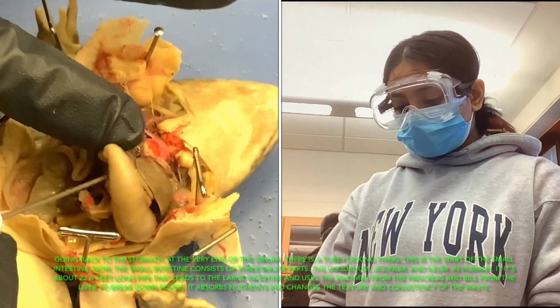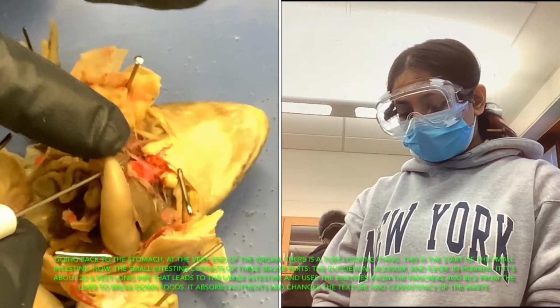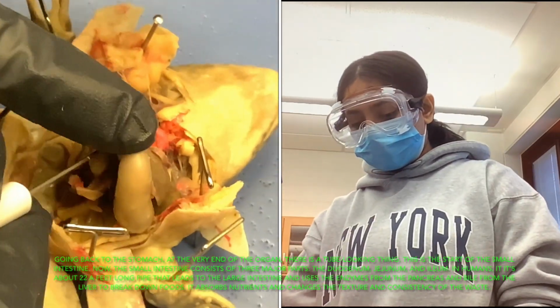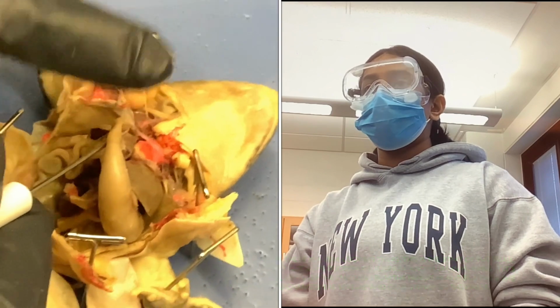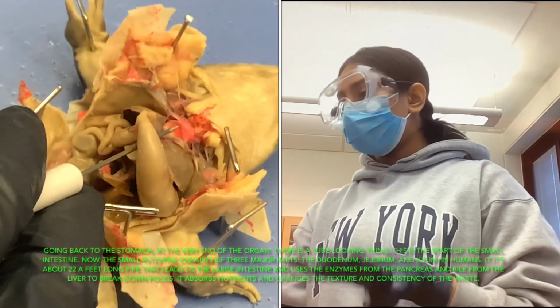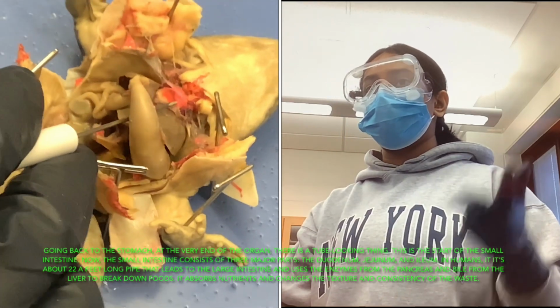We're going back to the stomach right here, and you can see I'm holding a little tube-looking thing leading from the stomach. That is actually the start of the small intestine. Now, the small intestine contains three major parts: the duodenum, jejunum, and ileum.